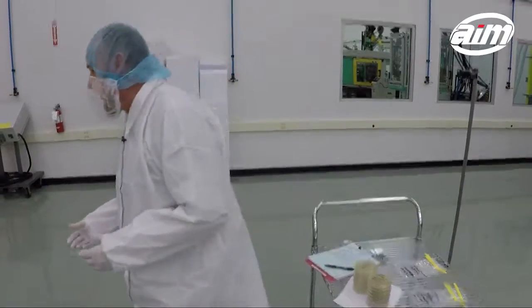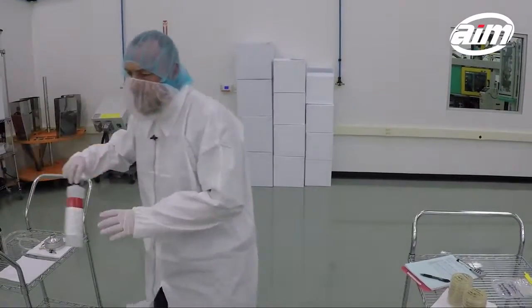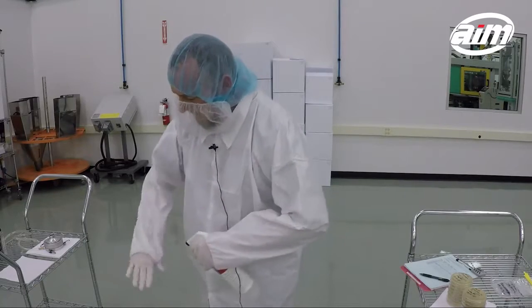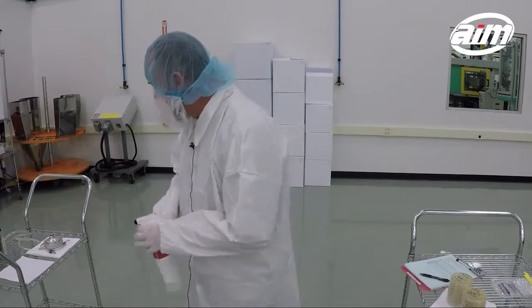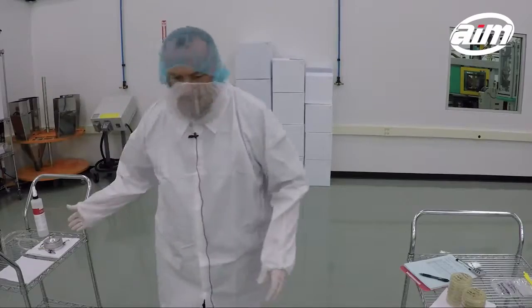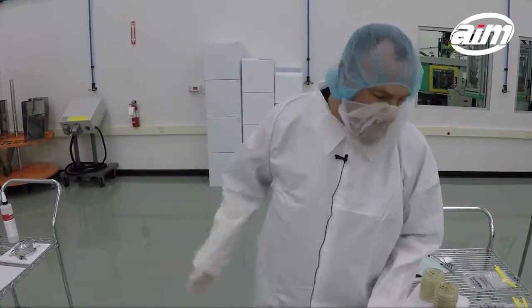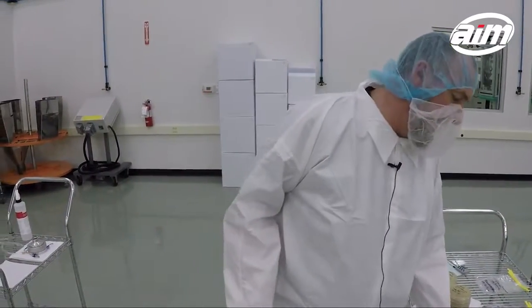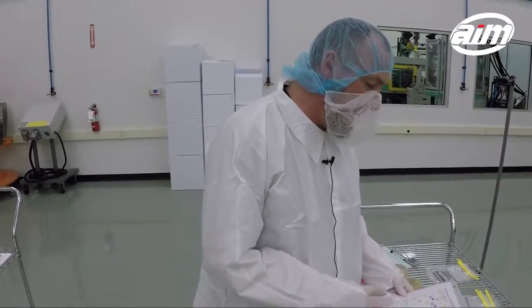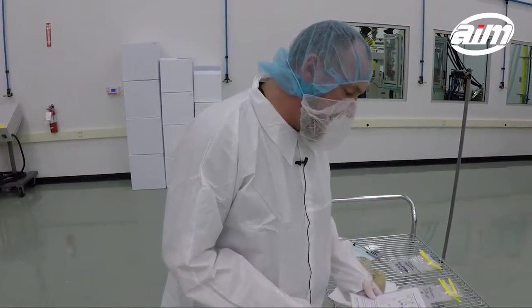I'm going to sanitize my hands with 70% isopropyl alcohol. I have the impactor in a location according to a sampling location map that I've put together for the collection of the samples.